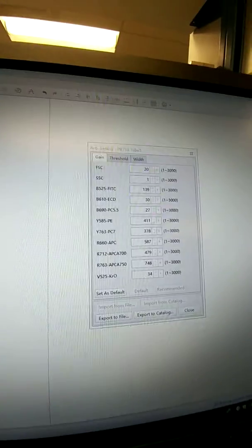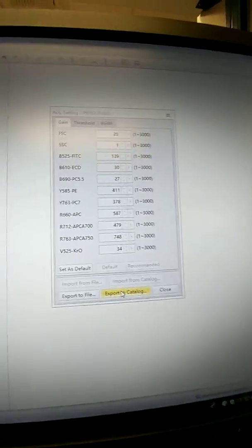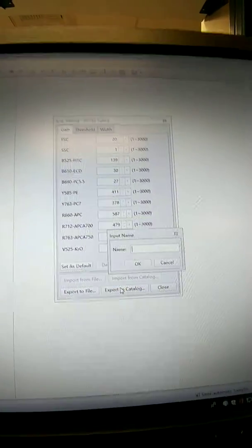Okay, so if you like that, then how you would save it is you could come here. We still have that same tube selected. These are our new acquisition gains. Okay, and our ECD also went down a little bit. Okay, so we're going to click export to catalog, sorry.